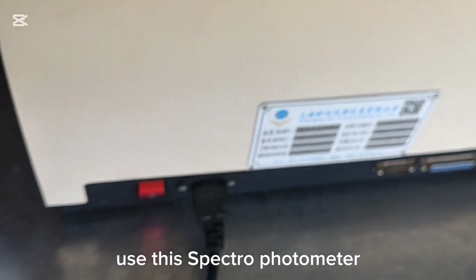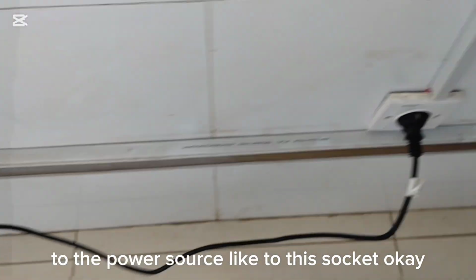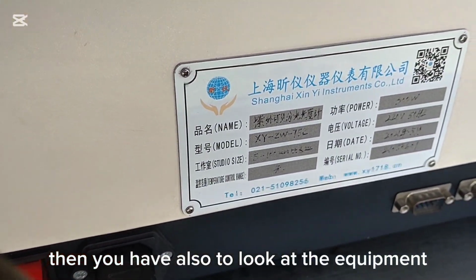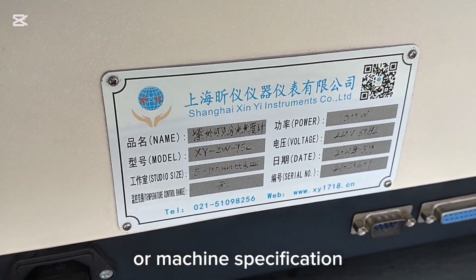Now, whenever we are going to use this spectrophotometer, we have to make sure that it is connected to the power source, like to this socket. Then you have to look at the equipment or machine specification.